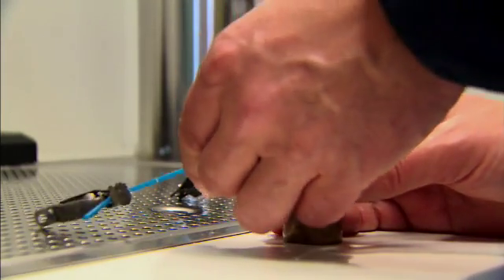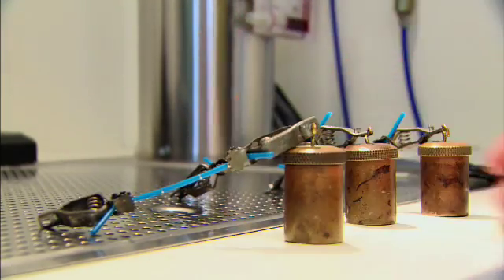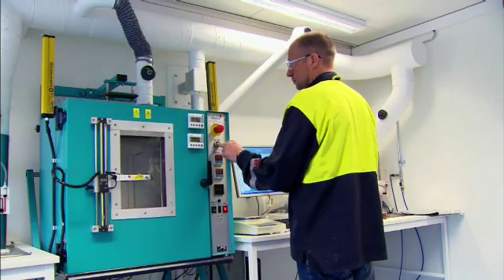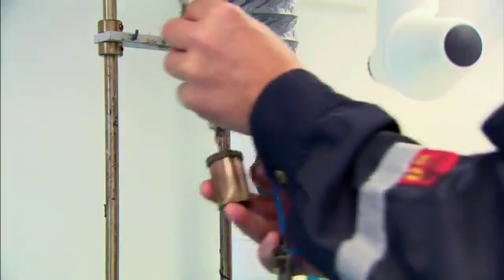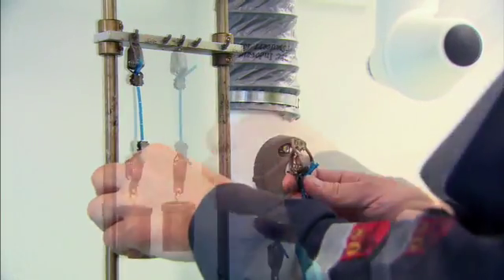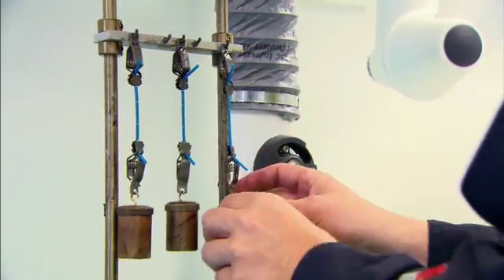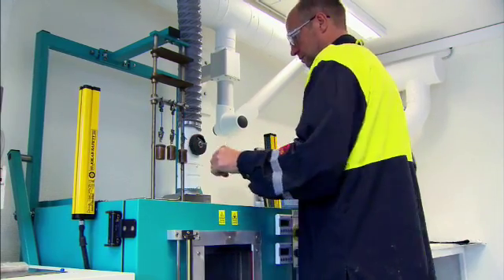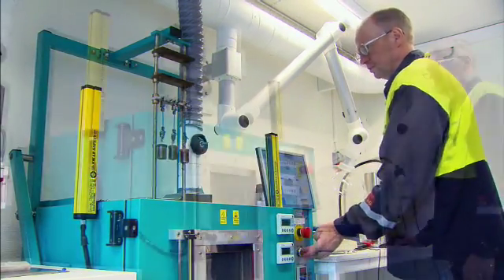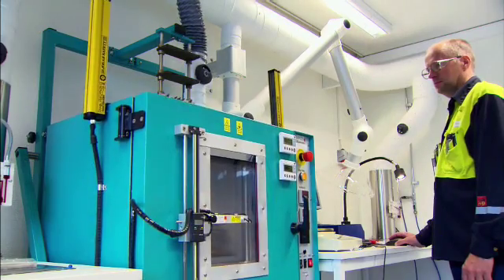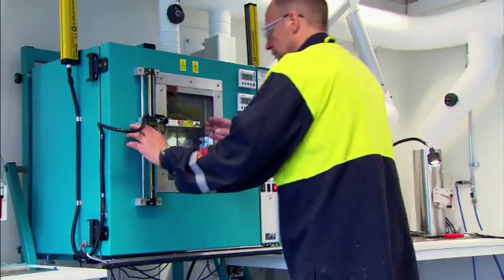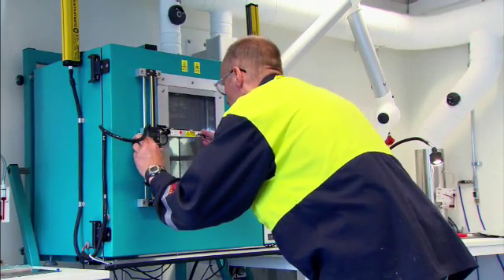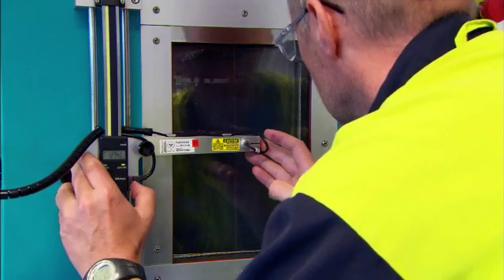Hang the test piece in the oven and attach the weights. After 15 minutes, measure the distance between the two marks and calculate the elongation.